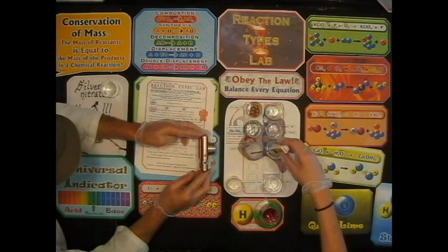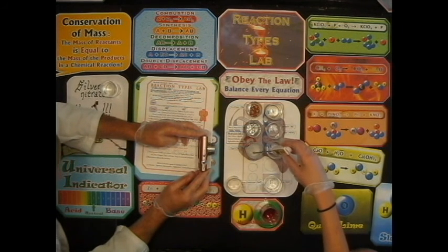Vigorous reaction. Look at them flying around in there. Lucy, can you see that from the side on your side? They're just flying around. Ugh, smells horrible. Good, that's what I wanted to mention. It's nasty. Hydrogen smells nasty with a Y.